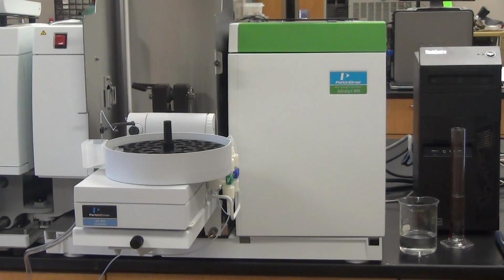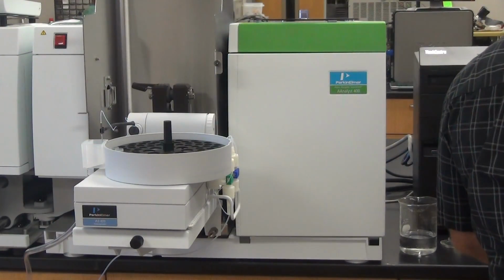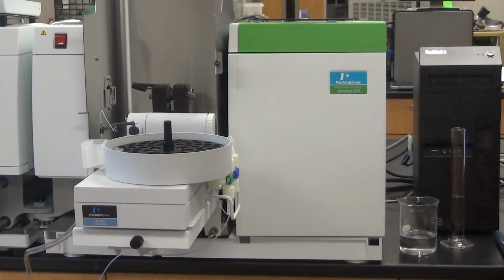I left the blank. There you go. I'm like, why did I leave that? So we save this. Okay. So we come back into here and we say rebuild the list. That's what we've got. Okay. And then I would analyze all, and we run these just like that. Or I go to select location 1.